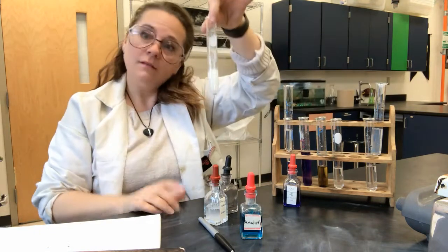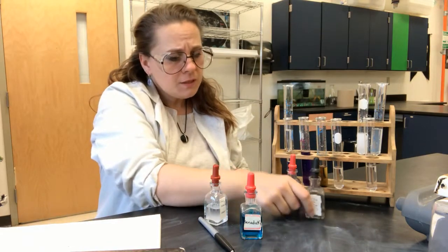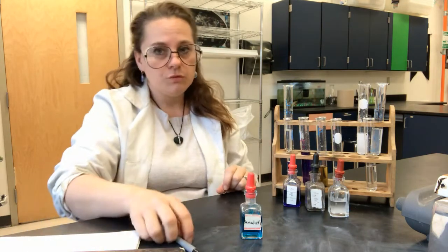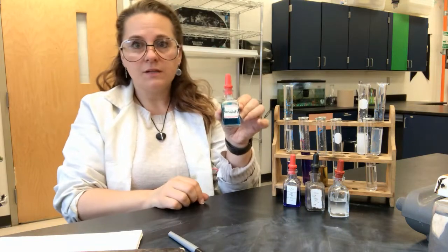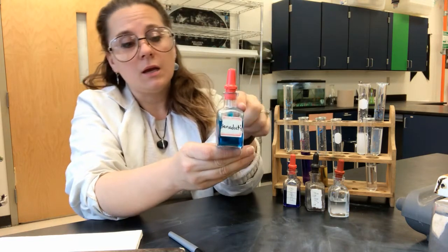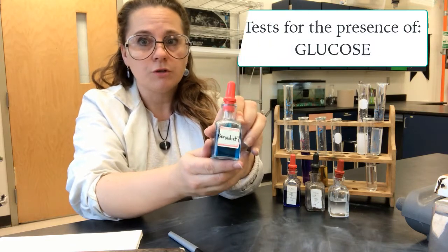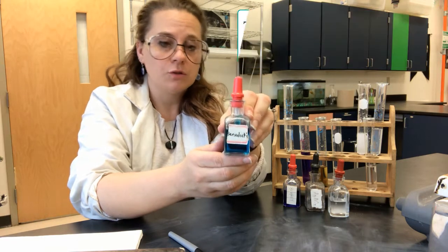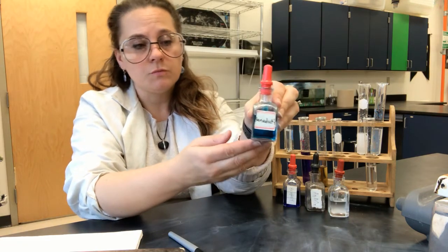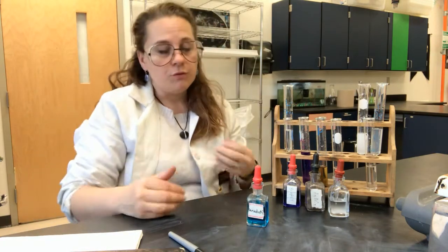Lastly, I saved this one because it has a little bit of a procedure to go through. We're going to use a solution called Benedict's solution, and this indicator indicates for the presence of sugar — specifically glucose and other very small sugars. You wouldn't use this for a more complex sugar, but you would definitely use it to find out if simple sugars like glucose are present in a solution.